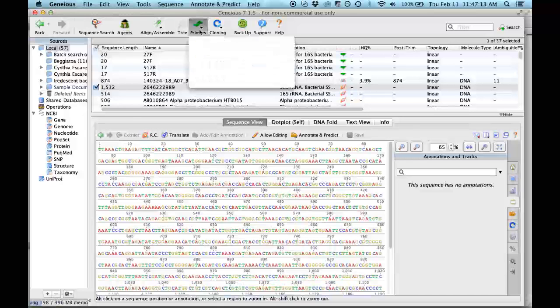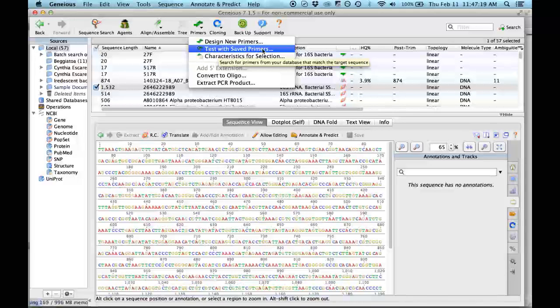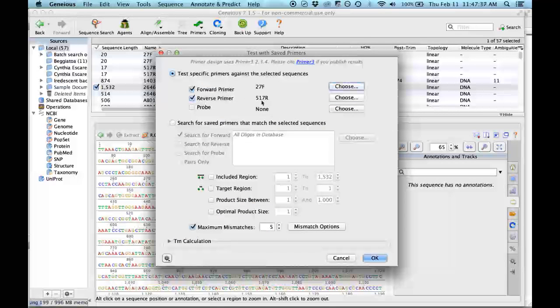So you go here to this primer tool, and you can test with saved primers because you already saved them. You can change here. Here you will have some primers that the program has by default, and the other one that we compared. I did this 3 times, but all are the same. So we pick the 27 and the 517. And here you can put the maximum number of mismatches. That means the primer isn't 100% complementary, so you are allowing some nucleotides that are not exactly the same in the same position.